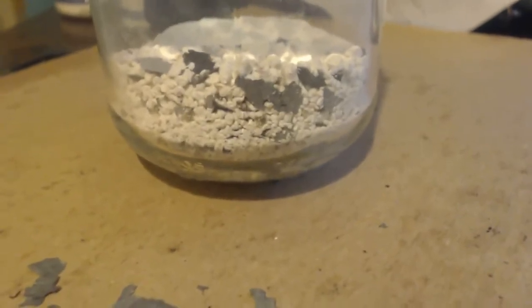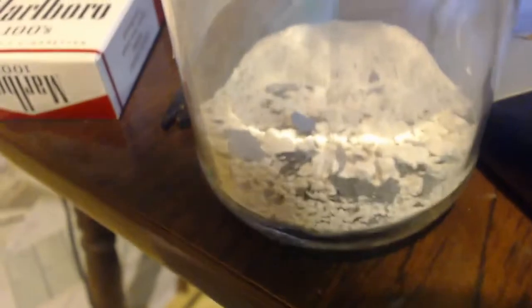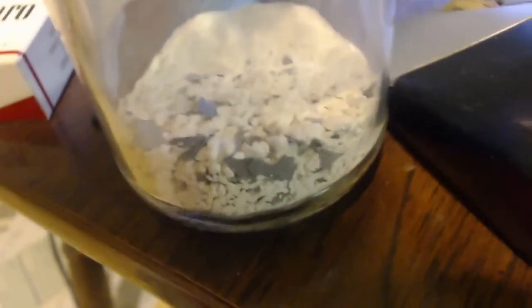But it did work. It should have come down to 40 grams, but I got like 46 grams or whatever I said. See what I mean, I'm going to do the same exact thing, I just need a different container. That container sucked.